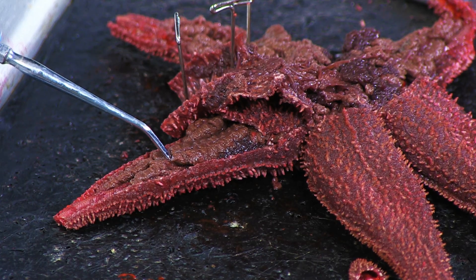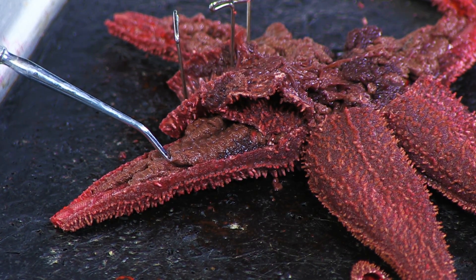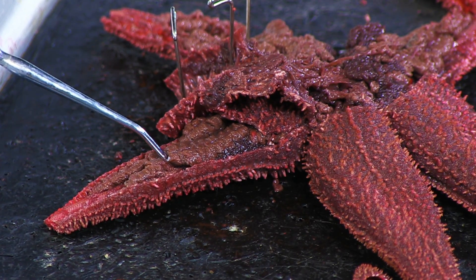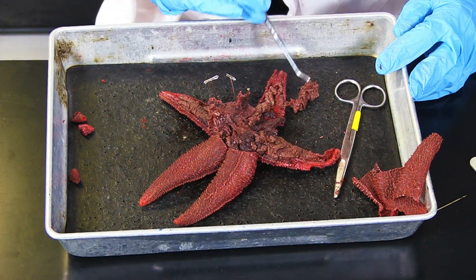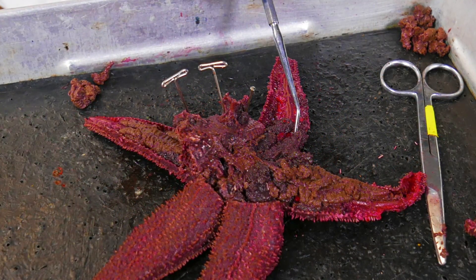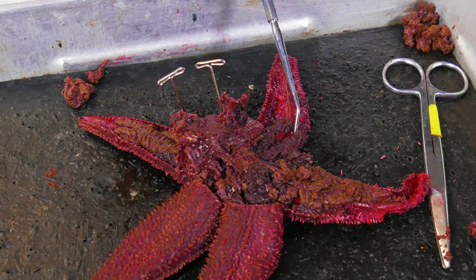In one of the arms, observe the pyloric cecum, which is seen as brown material just under the skin. These are digestive glands that secrete enzymes that break down food and store nutrients. When the pyloric cecum is removed, it exposes the gonads.